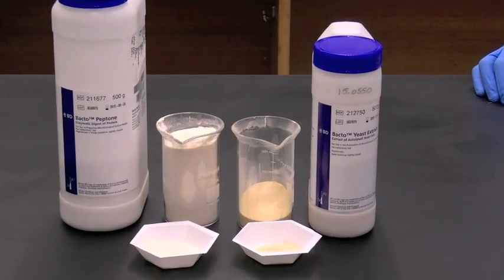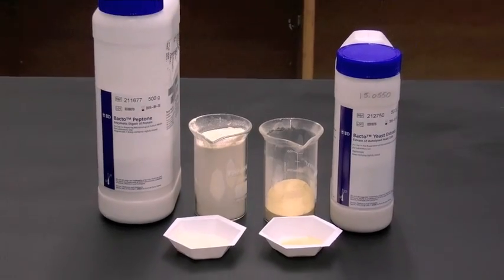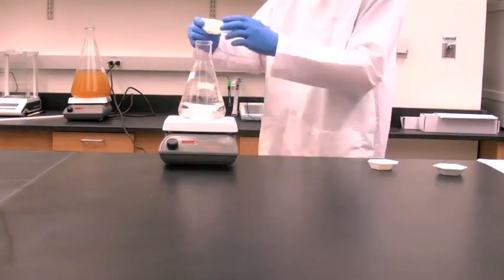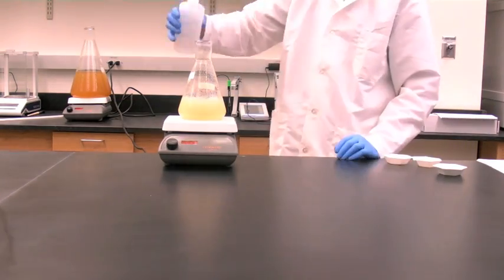Using a 1 liter flask, prepare optical density blank solution by adding 6 grams of peptone and 3 grams of yeast extract to 300 milliliters of distilled water. Stir until dissolved. Label and cover flask with aluminum foil.